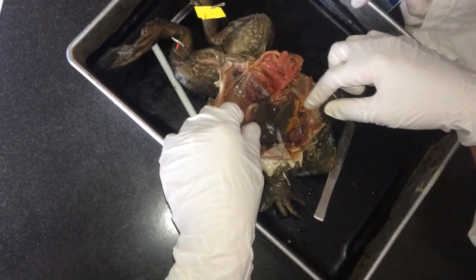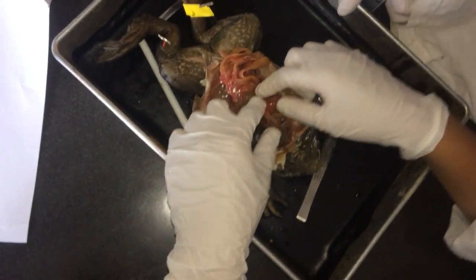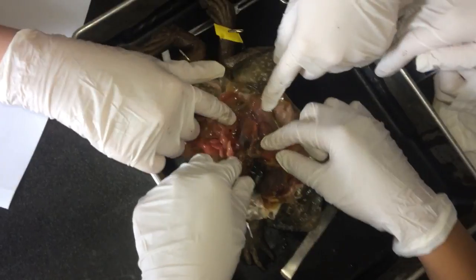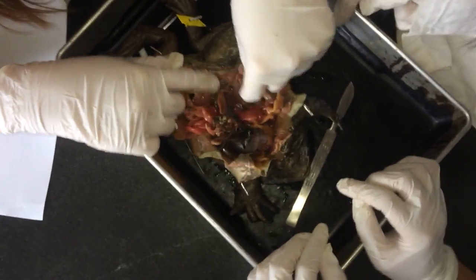Okay, I have hearts. Where's the intestine? Oh, is this it right here? Uh-huh. Right. Goes down, and then there's a urinary bladder. Oh yeah, right somewhere around here.